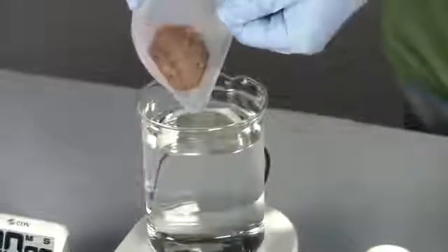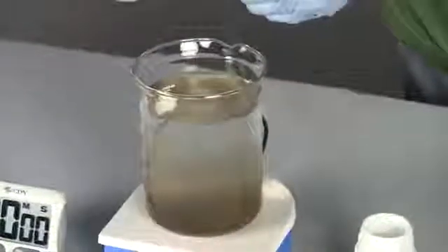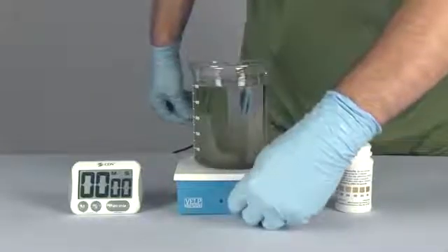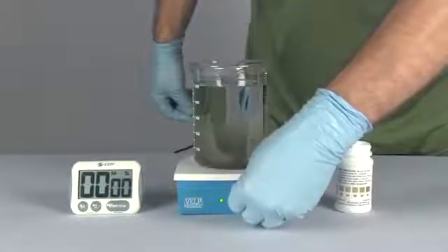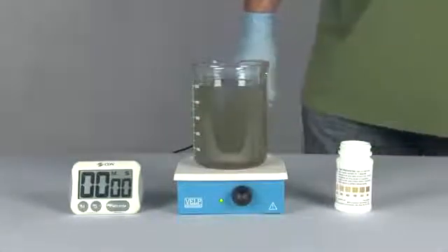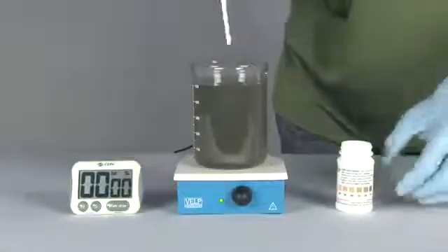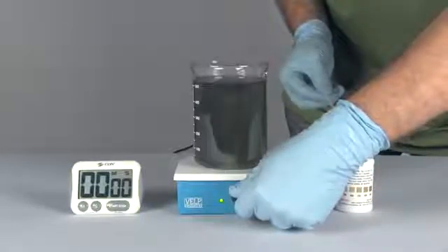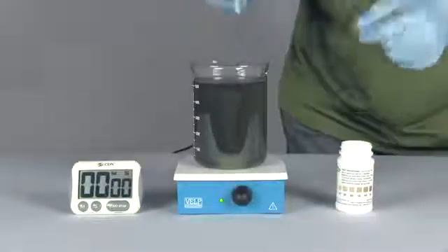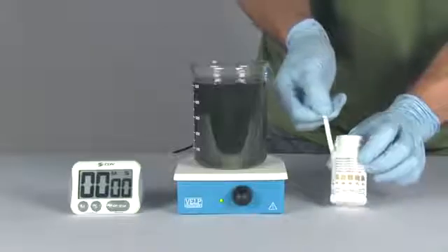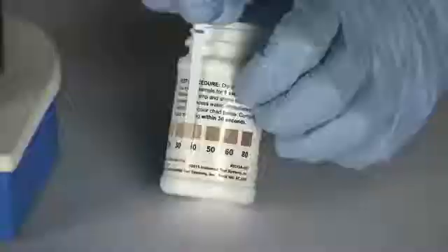10 grams of black salt is added to 500 milliliters of distilled water and the mixture is stirred. Using testing strips, the hydrogen sulfide level is measured. The reading is between 30 and 40 parts per million.